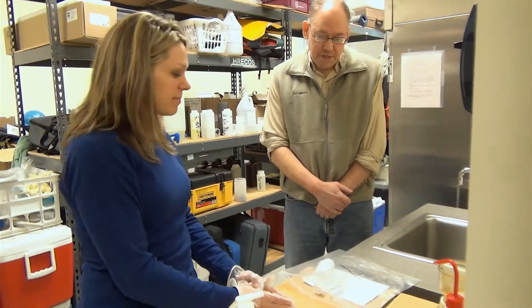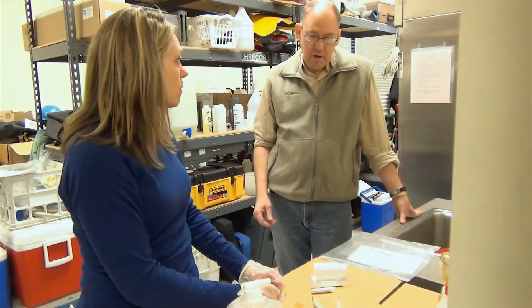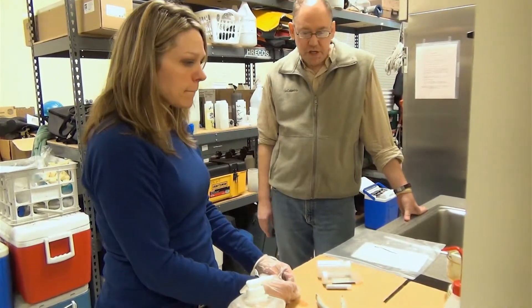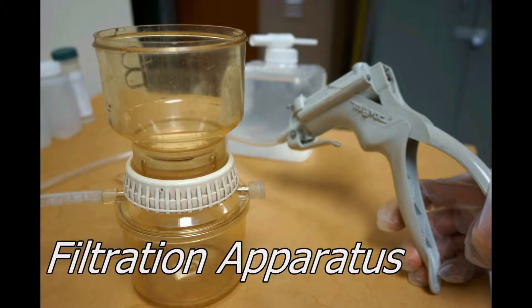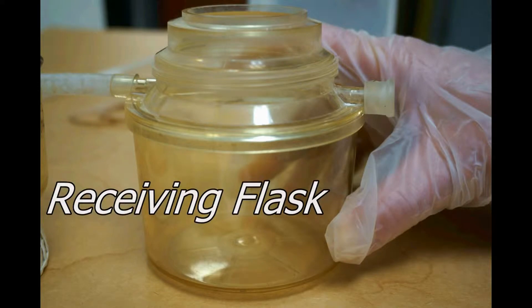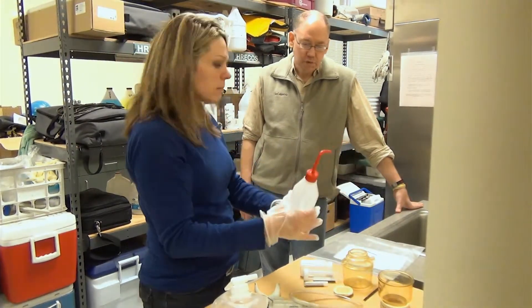The next part of the processing procedures is to take the remaining bottles and fill those with either the filter or the water that came out of the filtration. Before you do that, you need to prepare the filtration apparatus. That includes the funnel up top, the middle or center piece, and the receiving flask. Each one of those is going to be rinsed with distilled water, so we've provided you a bottle of distilled water.